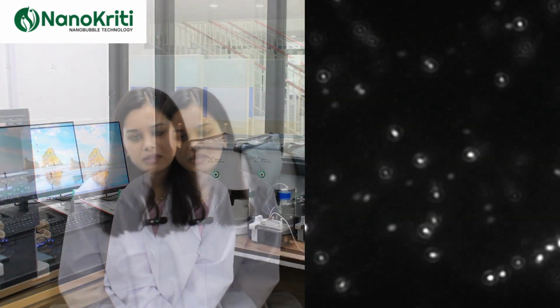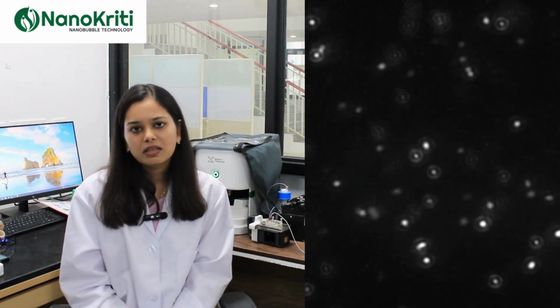Hello everyone. Since you all must be aware that our lab is the pioneer of nanobubble technology. So I'm one of the PhD students working under Dr. Neelkant Nirmalkar, and my name is Shivigar. I'm a PMRF fellow in the Department of Chemical Engineering, IIT Ropar. Since our entire lab works on nanobubble technology, it's highly important for us to characterize the nanobubbles that are present in our day-to-day samples.